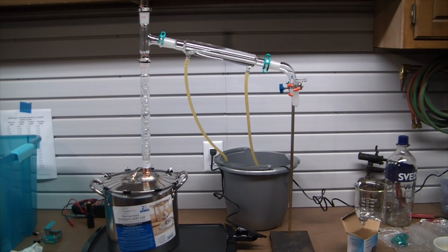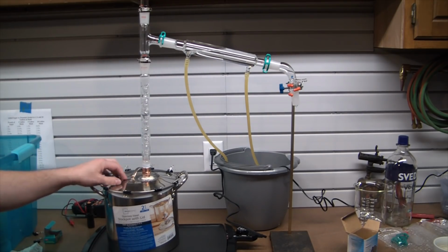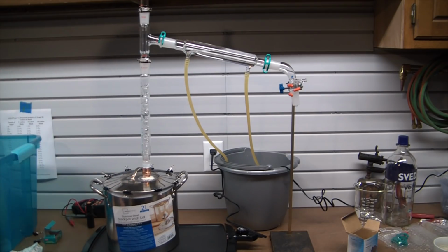The solder I got for some reason just wouldn't adhere to this Chinese stainless steel. God knows what kind of crappy alloy they're using, so I think that's probably the issue, because I know the solder I got was good quality and I was using the right flux. But it's what it is.